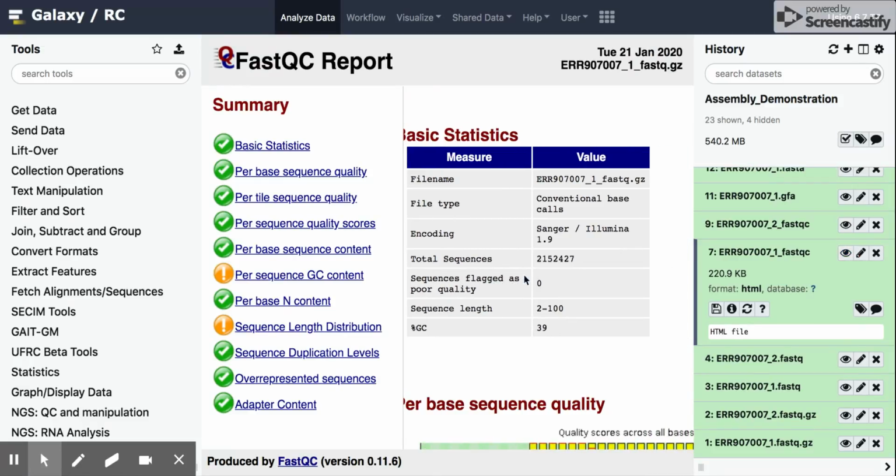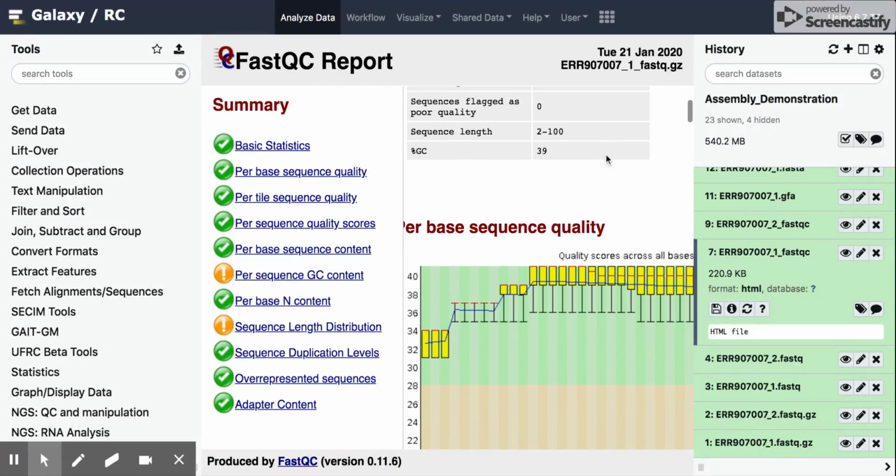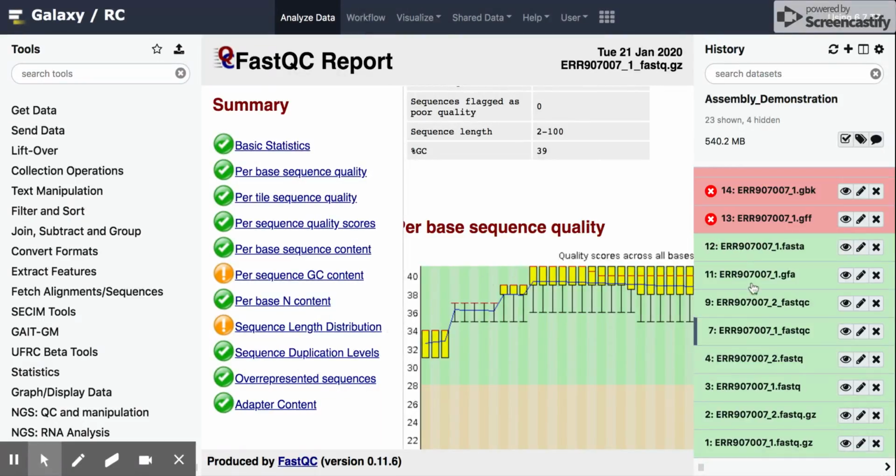There's a number of valuable pieces of information in here, which are all hyperlinked to the left. This is actually an HTML file, which you can download, again, using this save button right here, and then open in your browser to analyze the performance of your quality trimming, and also look at some information about the reads themselves. Again, we'll spend a separate video looking more in detail at assessing the output from FastQC. So those two steps performed satisfactorily.